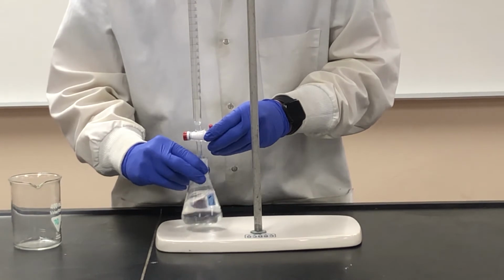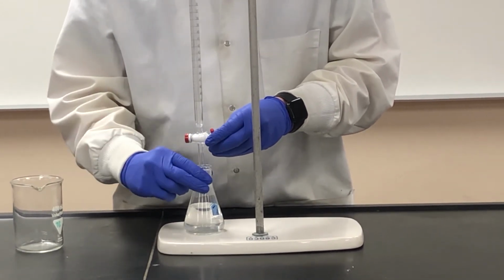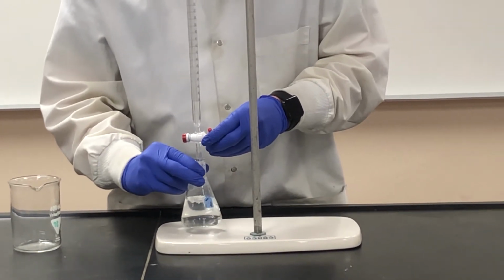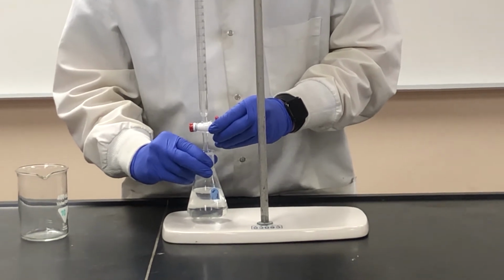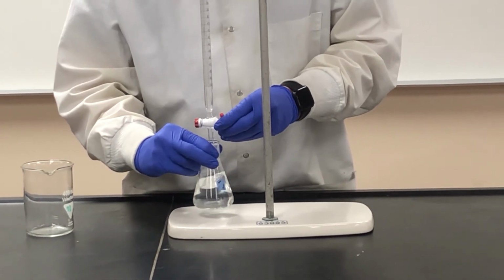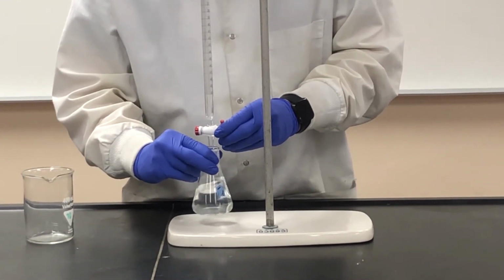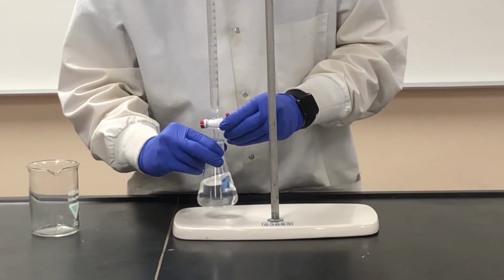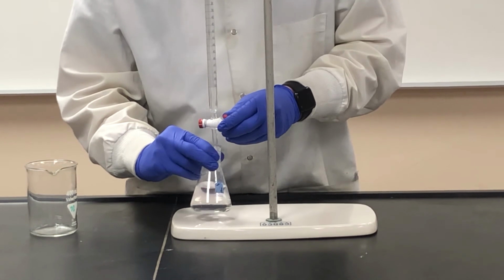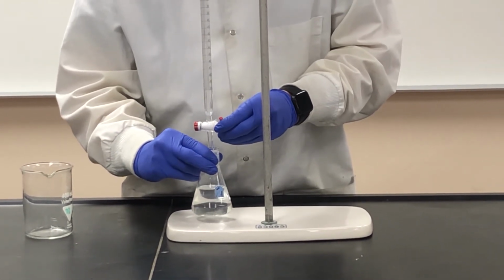At this point, if you were doing the titration, you would definitely want to be going drop by drop, and maybe even stopping every now and then just to make sure you can completely swirl it to get it to go away. At this point, since we're approaching the endpoint, a single drop, half a drop can be all we need to change it to the pink we want.